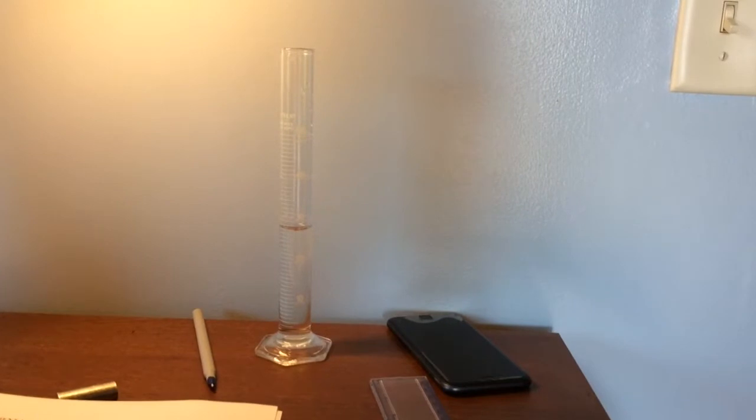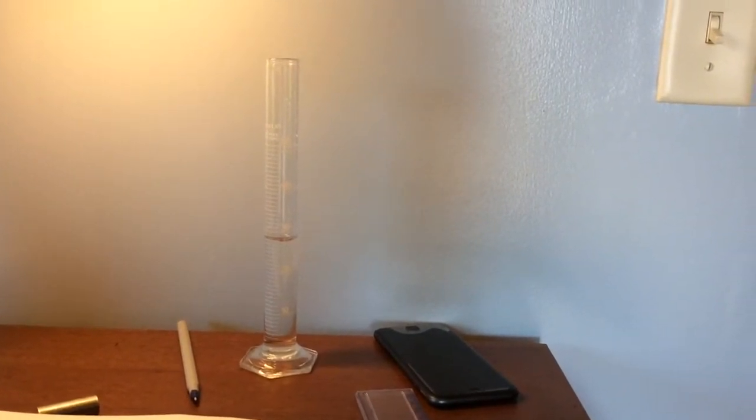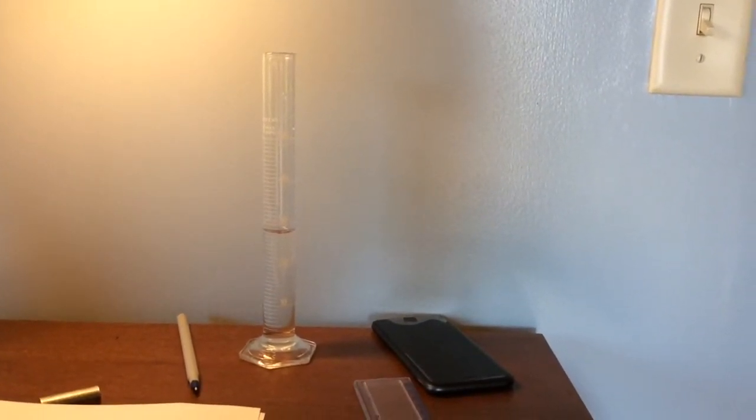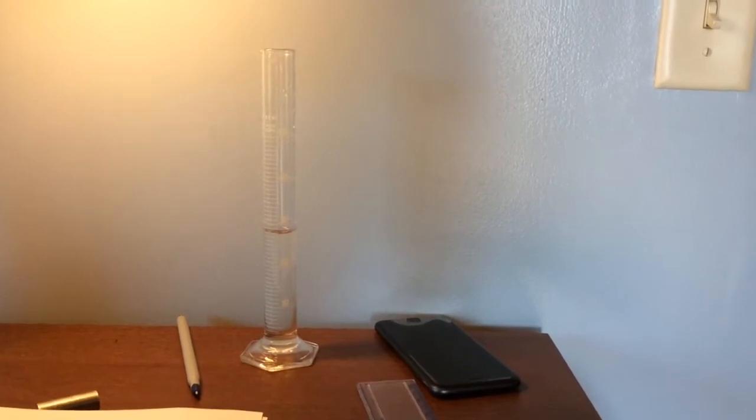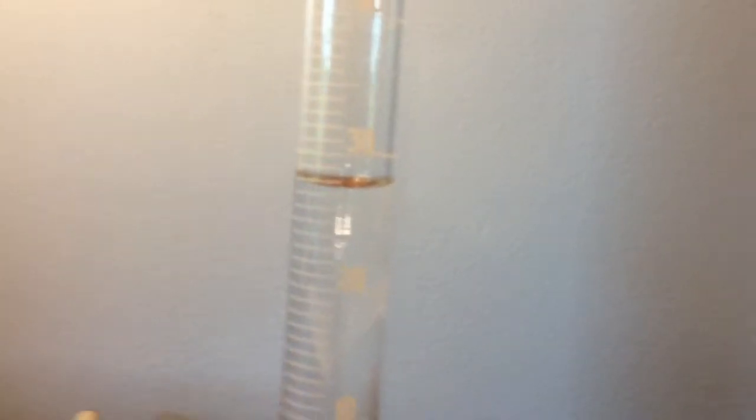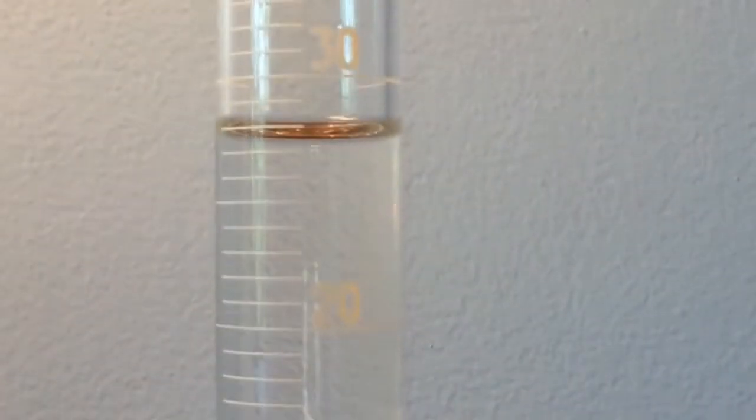In part 3 of the experiment, we're going to measure the volume contained in a graduated cylinder with and without the metal cylinder. So we half fill our graduated cylinder with water and then we carefully read what that is. Focus for me.